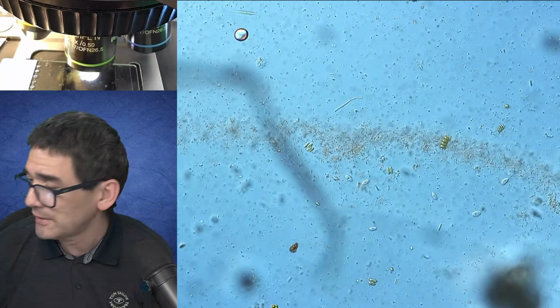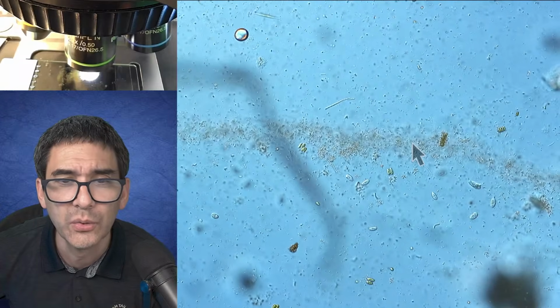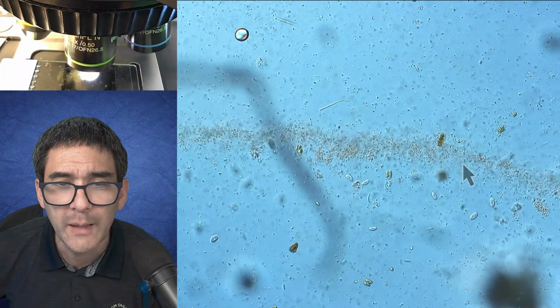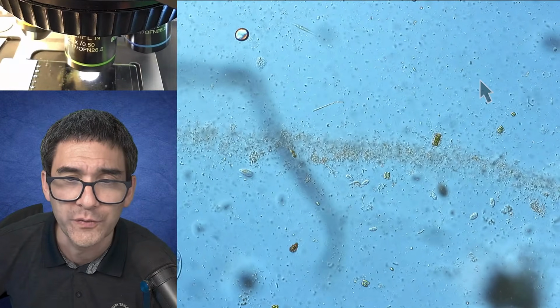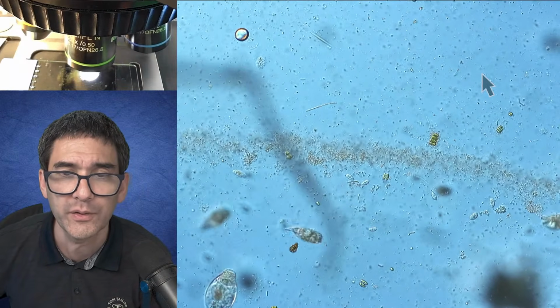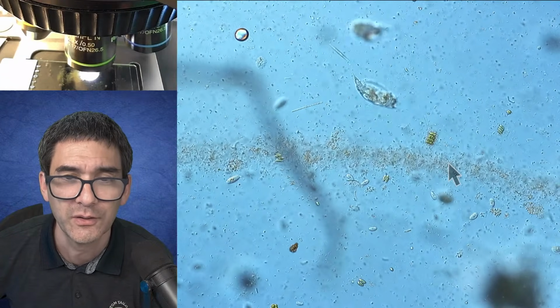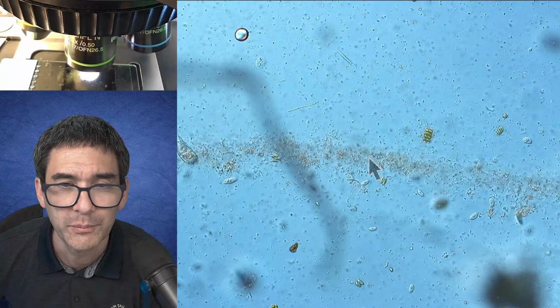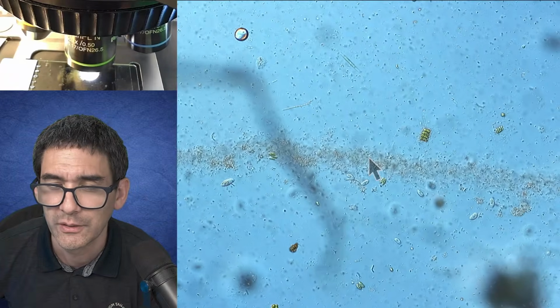Do you actually see that there is over here almost like a road of bacteria? What will normally happen is that they will start to move in one direction together over the course of a couple of minutes. The reason is they will move towards the edge of the cover glass where there is more oxygen present. So they're traveling together towards the side. It's right in the middle of the image.